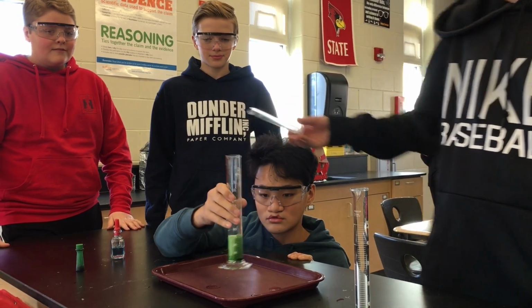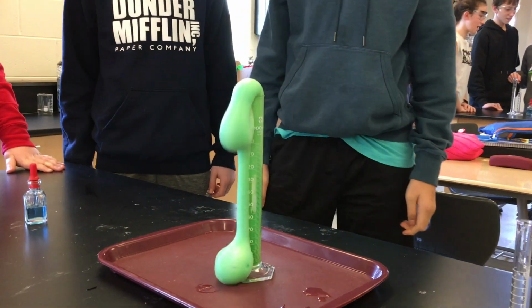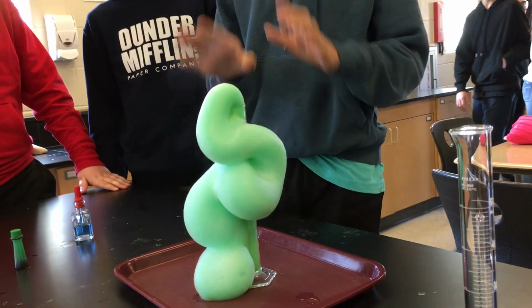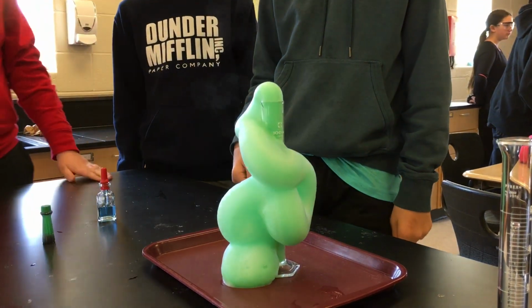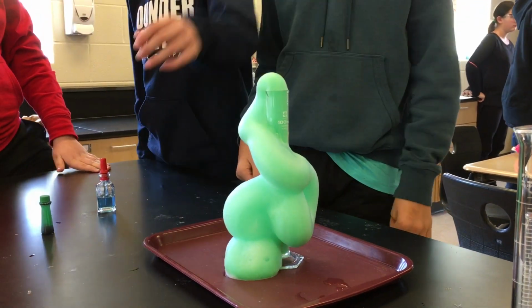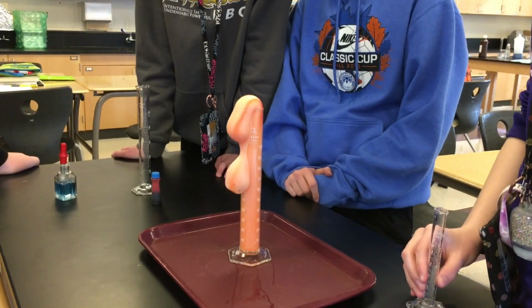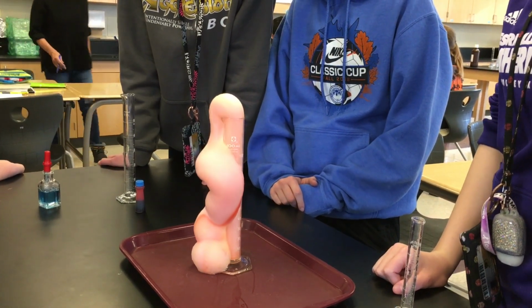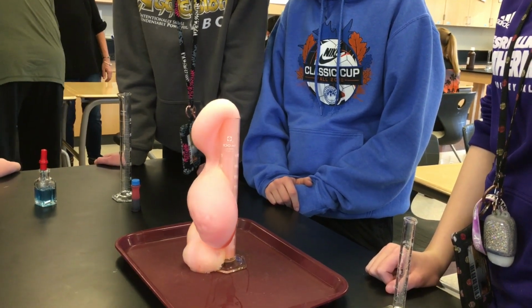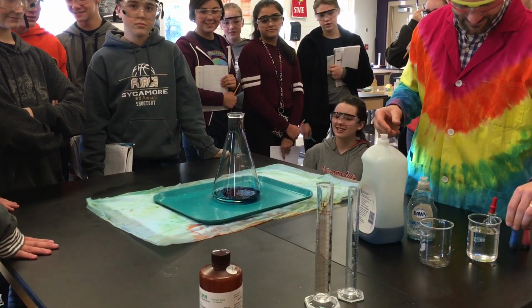As you can see here, these are some of the groups that were working in class today. They took a graduated cylinder, they put the two chemicals in, and when they mixed soap and hydrogen peroxide and then added their catalyst, the potassium iodide, they came up with this really foamy, gooey stuff. If you're wondering why it's different colors, we just added dye to them to make them different colors. So anyway, we get this foamy elephant toothpaste looking substance. And it was a lot of fun to look at. So let's break it down.